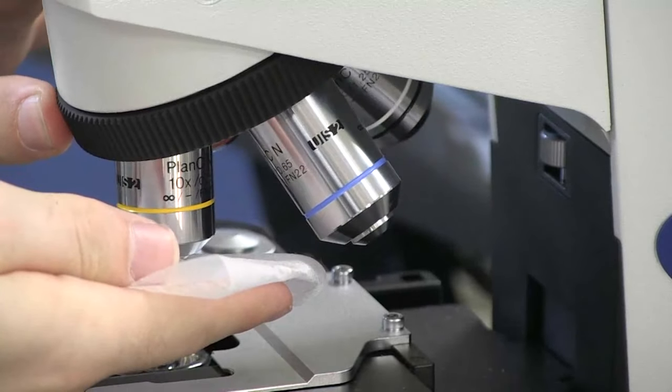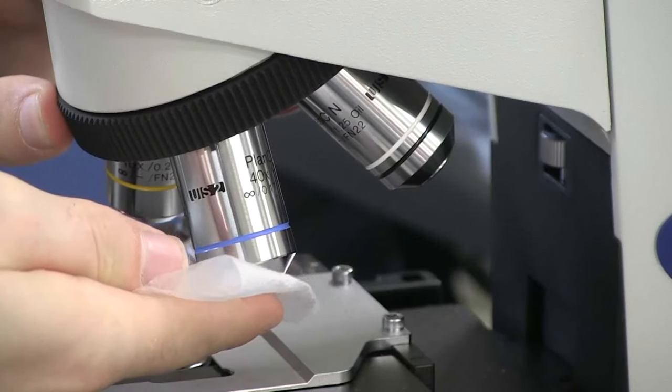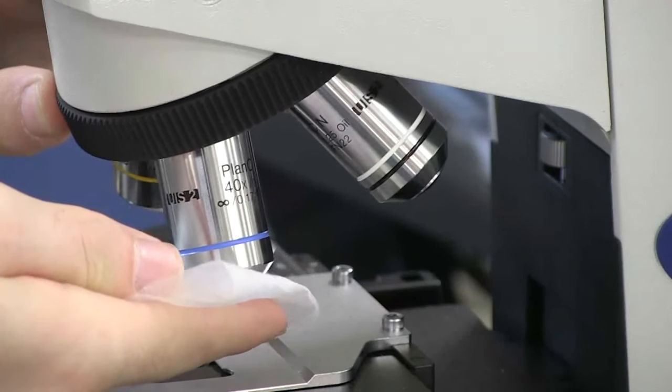Clean the ocular eyepiece and objectives using lens paper. This paper will not scratch the lenses.